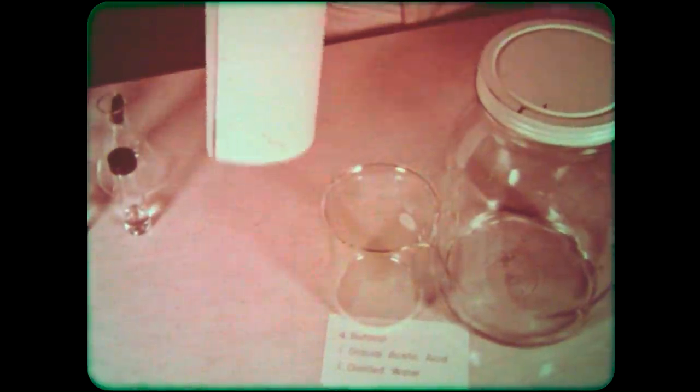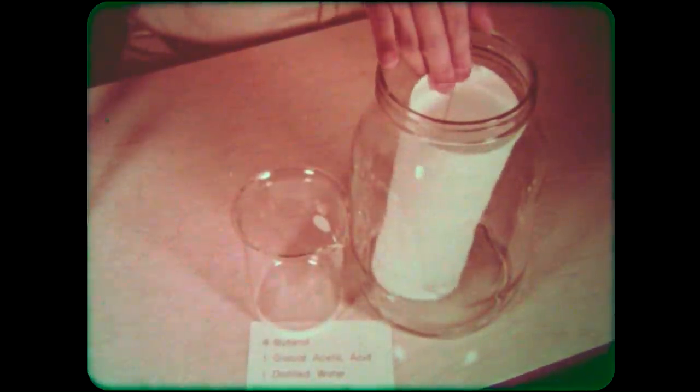The rolled and stapled sheet, handled only by the edges, is carefully placed in the chamber. It is removed about four hours later before the solvent front has reached the top of the sheet.